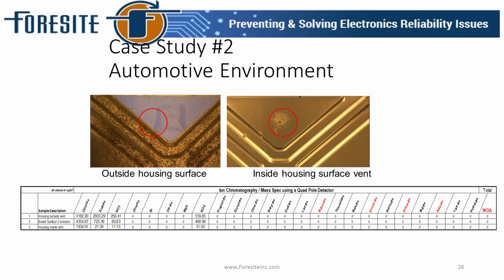And when we looked at it with IC mass spec, we found that there was no flux in that residue, but there were very high levels of chloride and acetate and sulfate. So taking a look at that, it was, again, an outside salt that was deposited on the board surface that was directly in relationship to the area we're looking at.